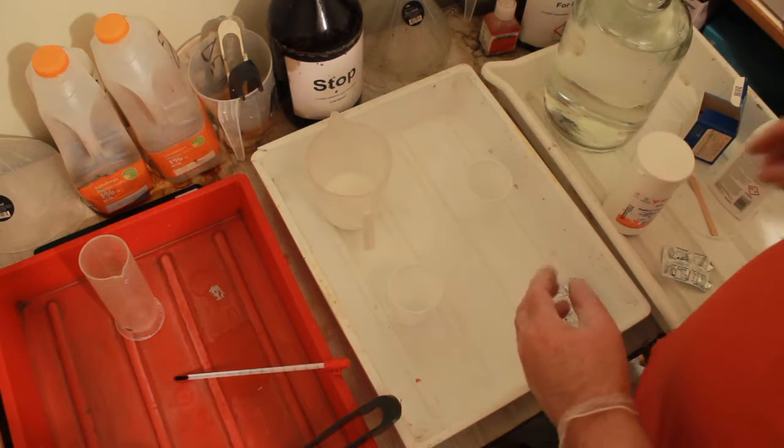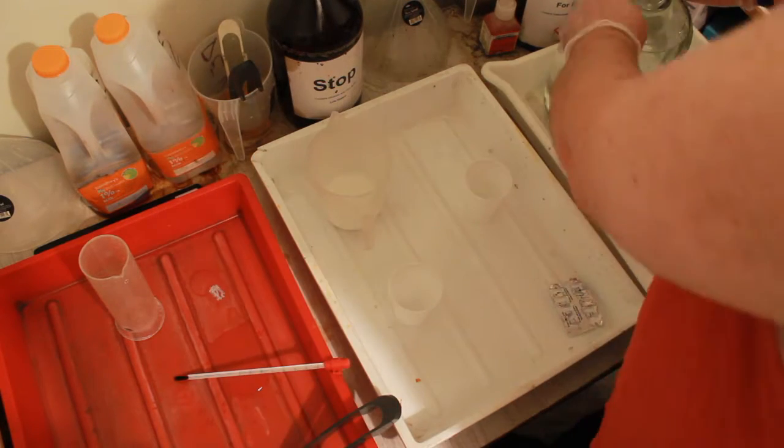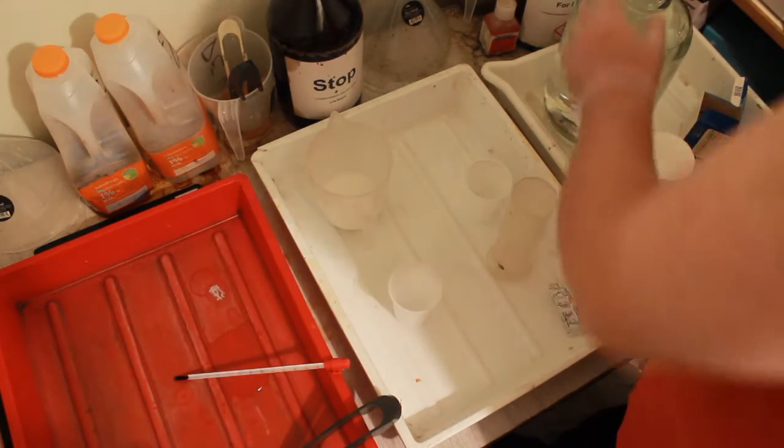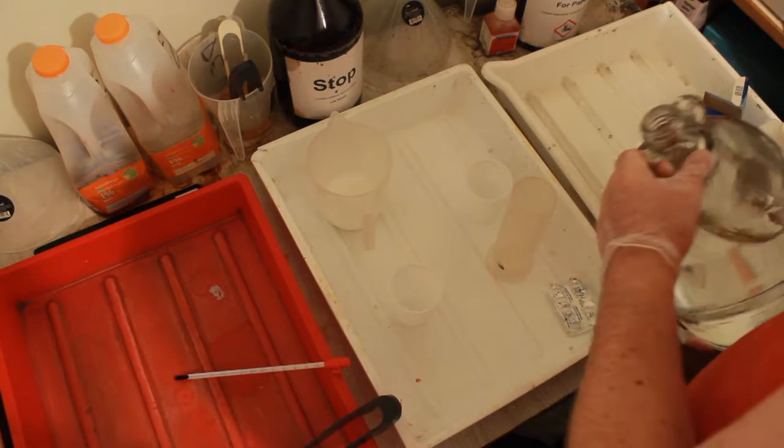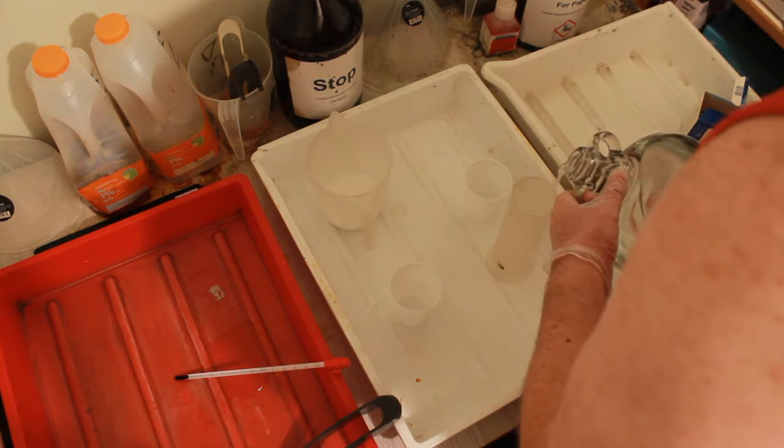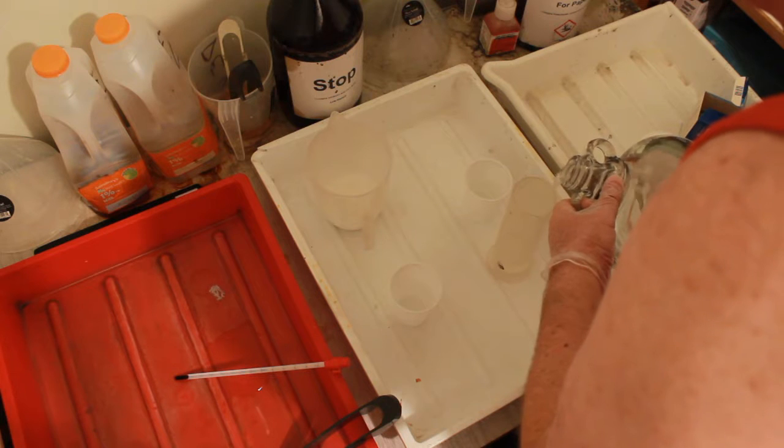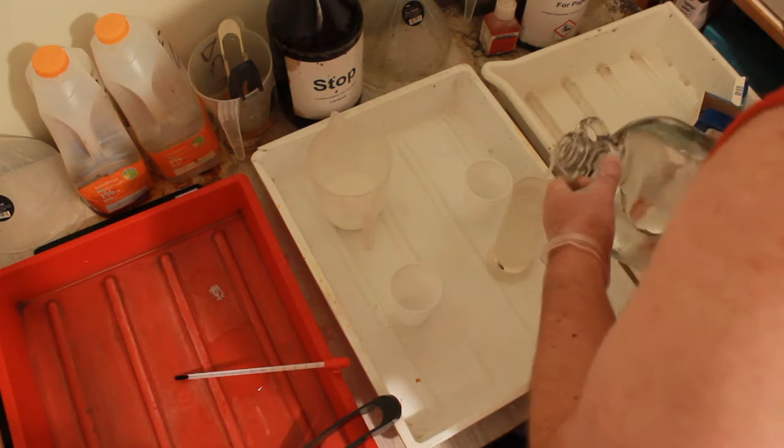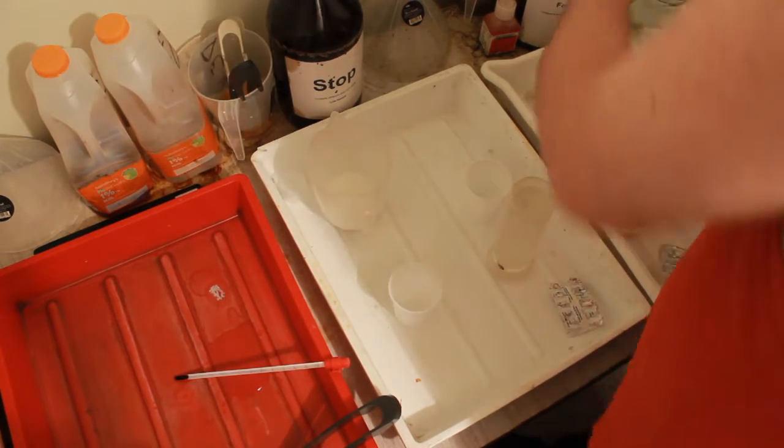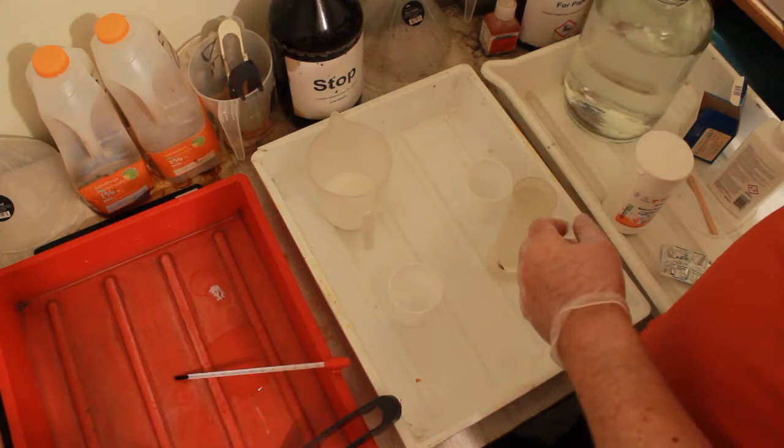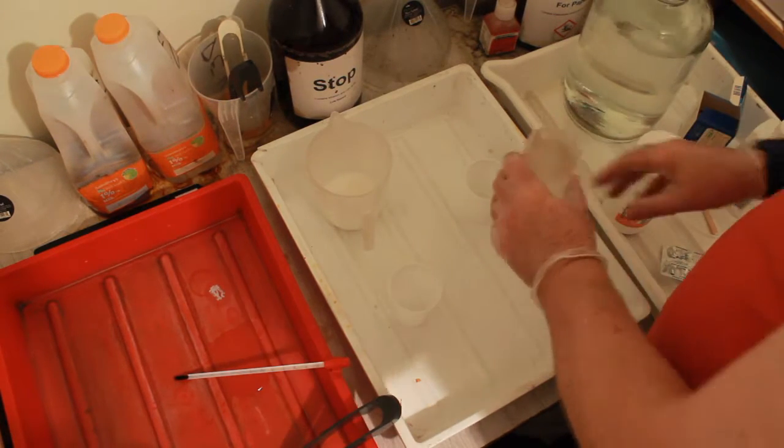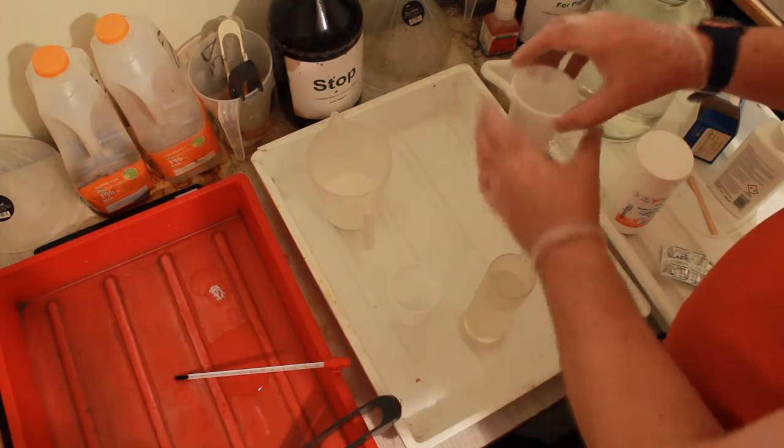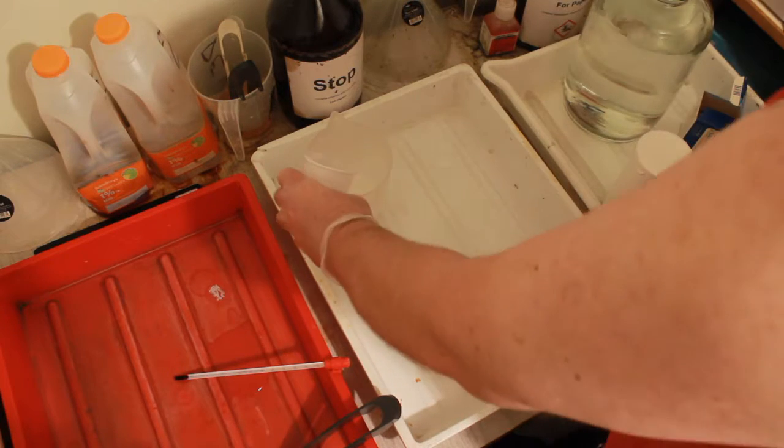I'm going to slosh in a bit of water. We've got to make this up to 500ml. It's got to be at least that much. I'll put a bit in there. That will help cool this down. Yes, that's much more acceptable. I can pour it into there now.